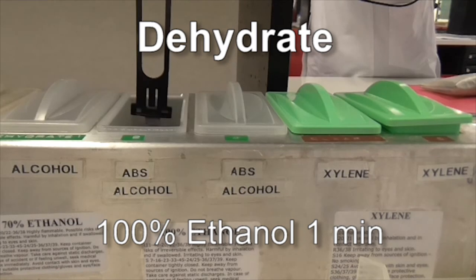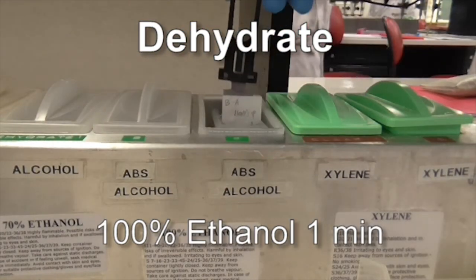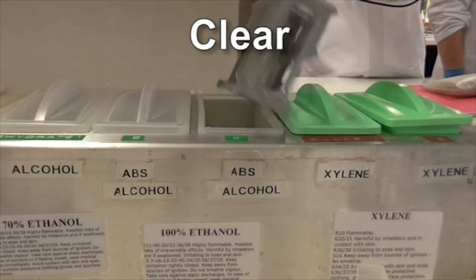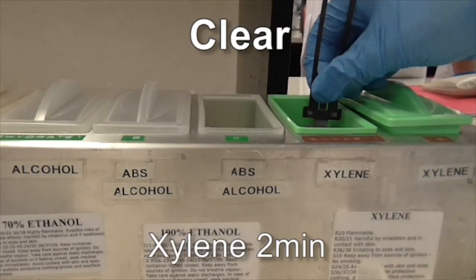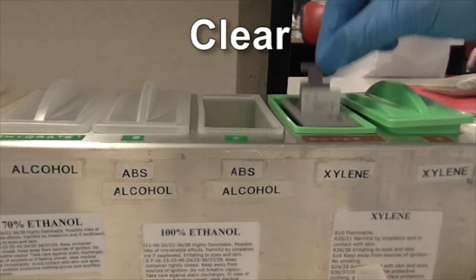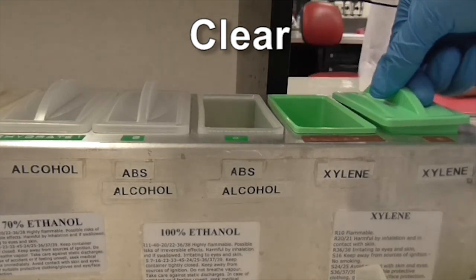We will now dehydrate the tissue sections. Place in absolute ethanol for 1 minute and again for another 1 minute. We will clear it in xylene for 2 minutes, then place it in xylene again for a further 3 minutes.